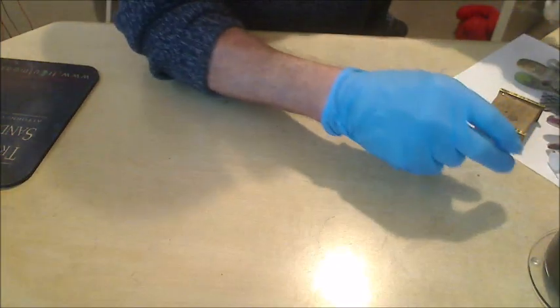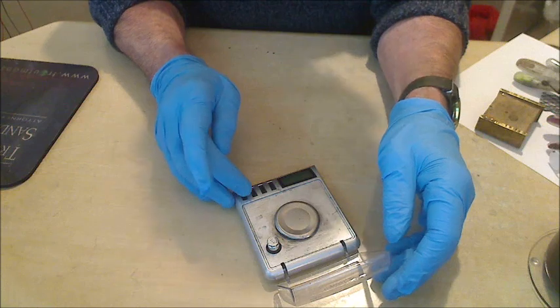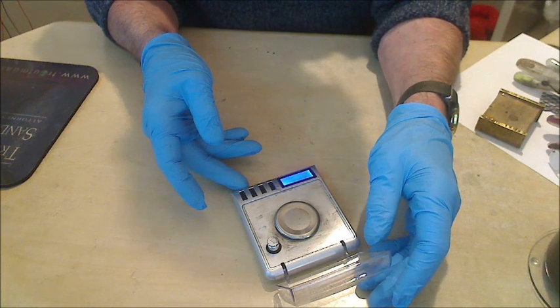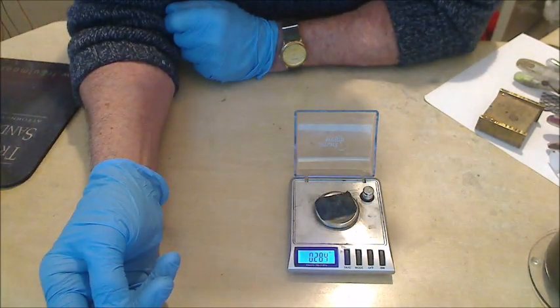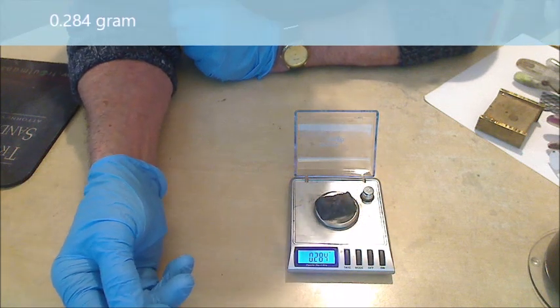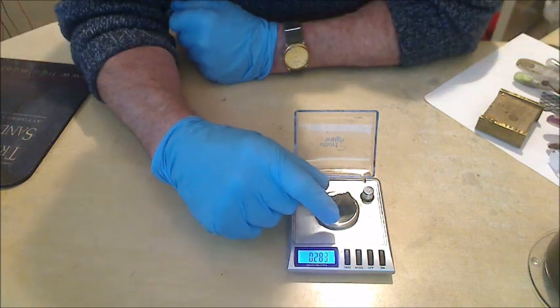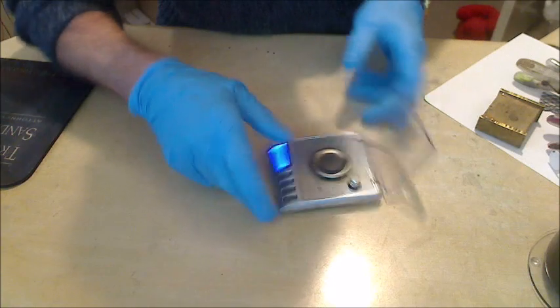I have also made some foam with my graphite, or graphene. That's what I'm making. This again is quite light, which points to me probably having graphene of some kind. If it was graphite particles, you wouldn't even be able to form it into a foam. It would just fall apart. So that again is another example.